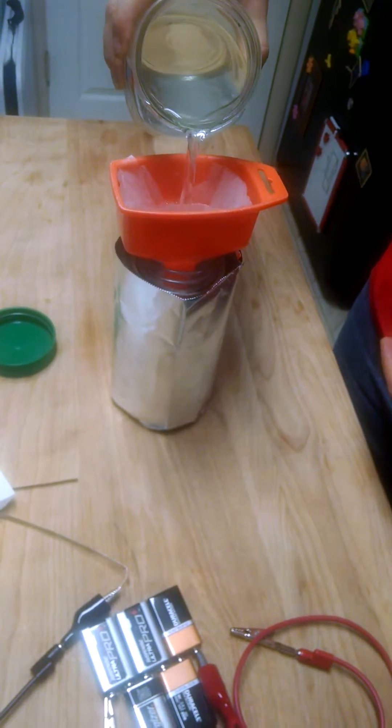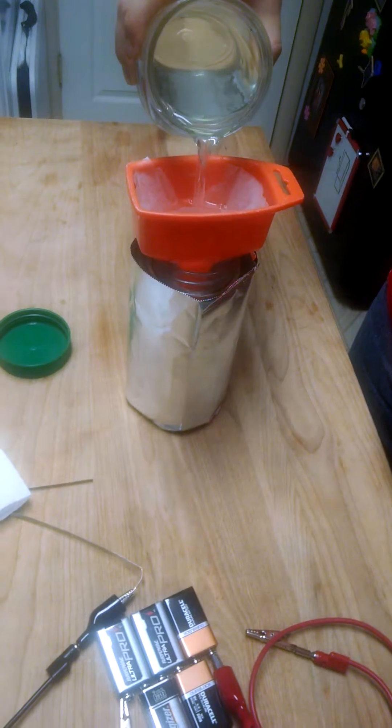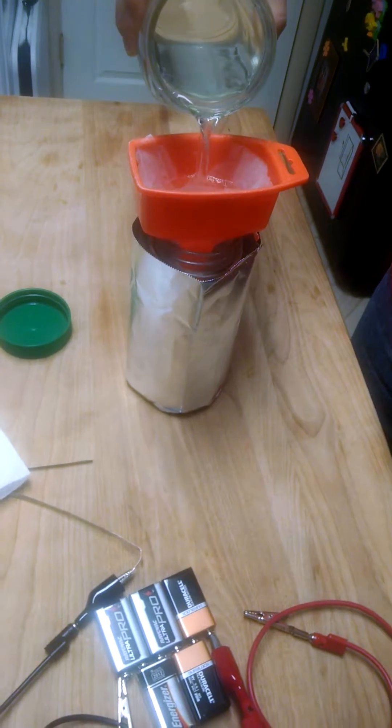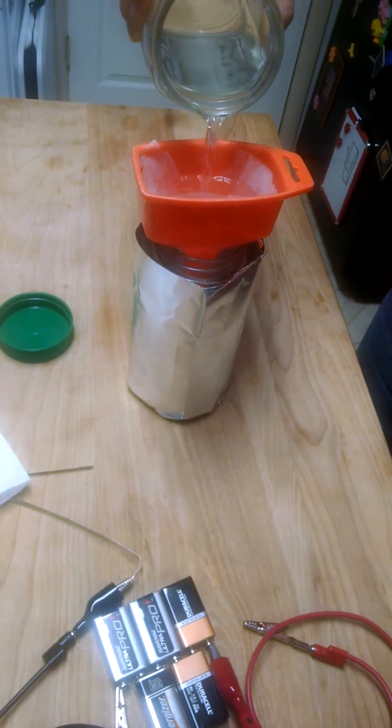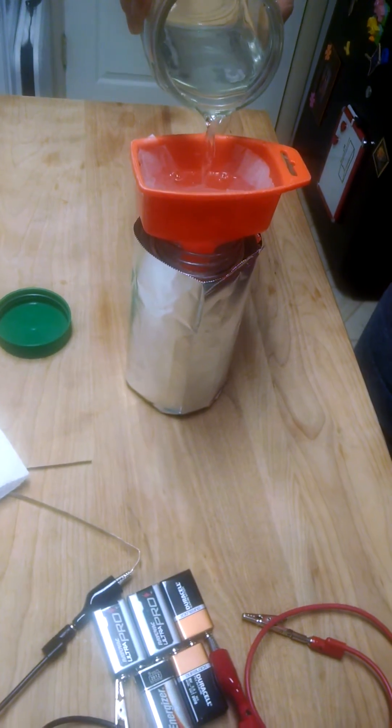Before it starts oxidizing, it'll turn a golden brown color to a dark gray. Alright. And that's it. Have fun.